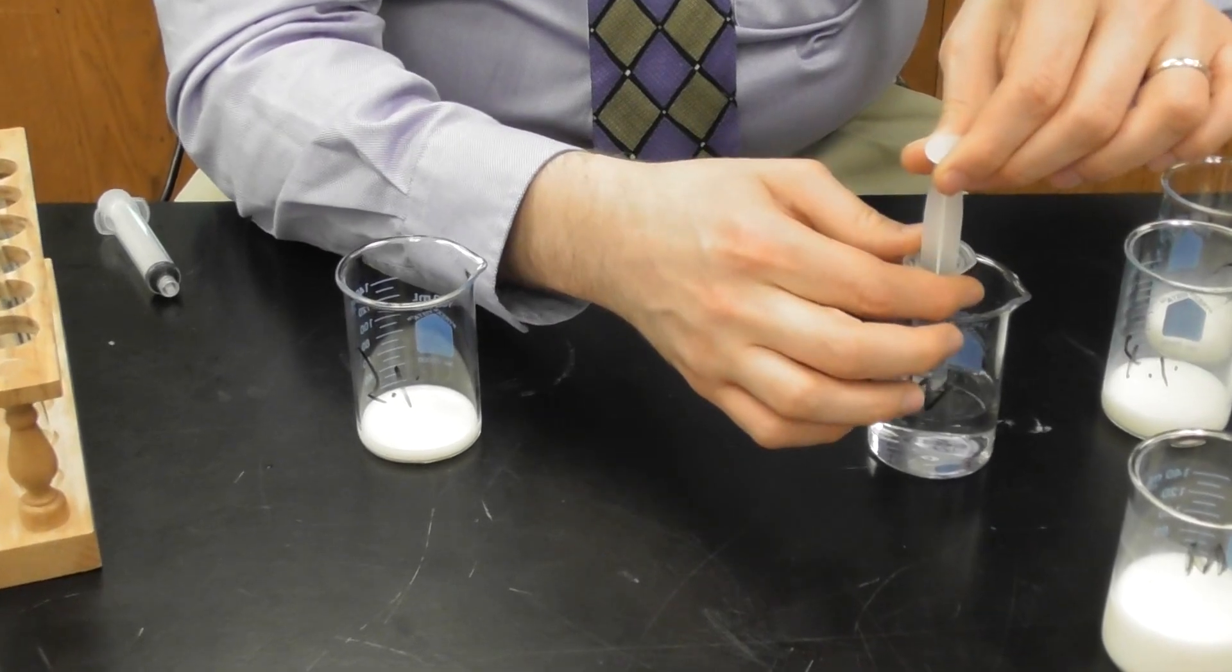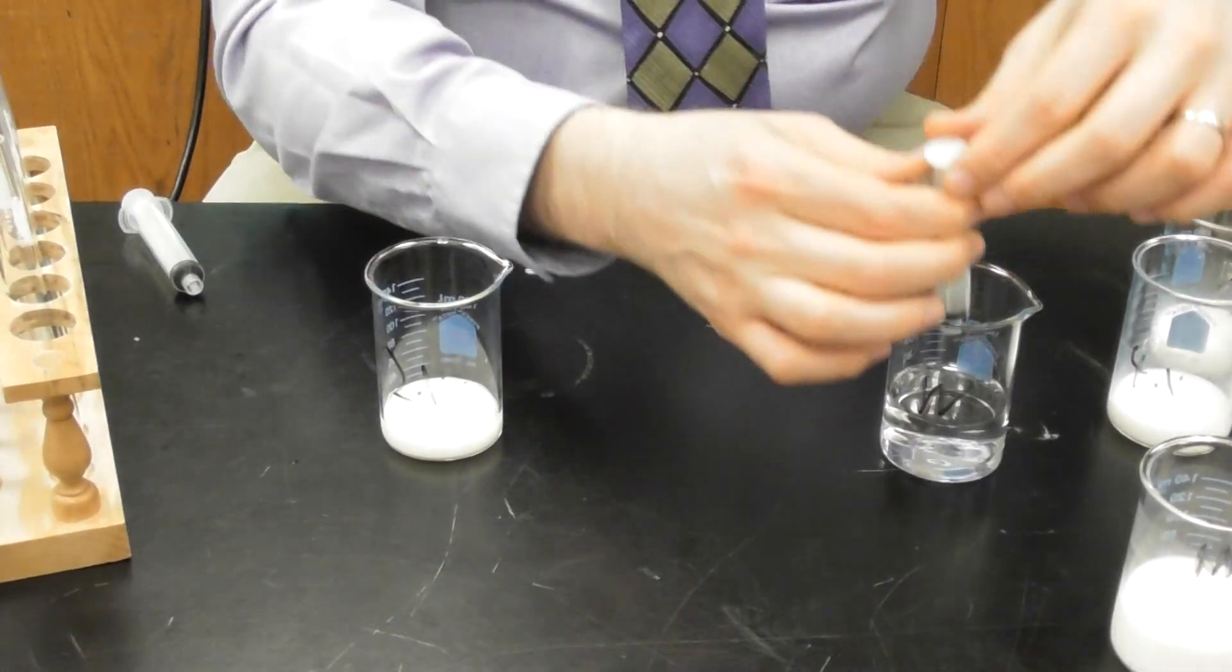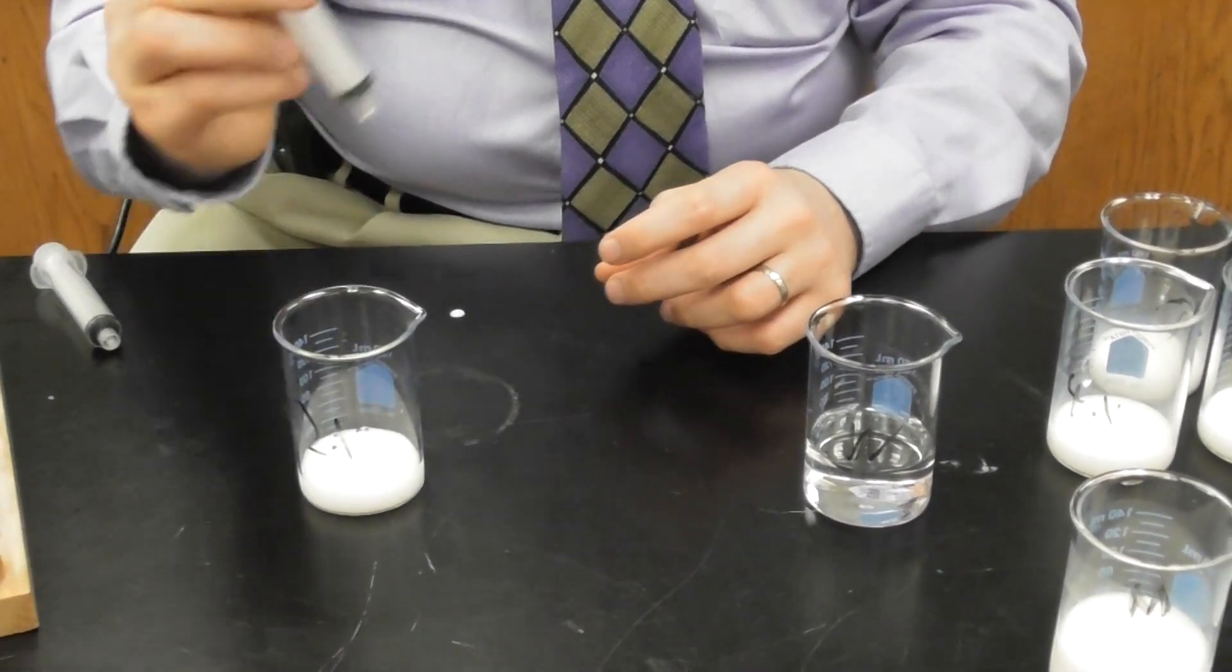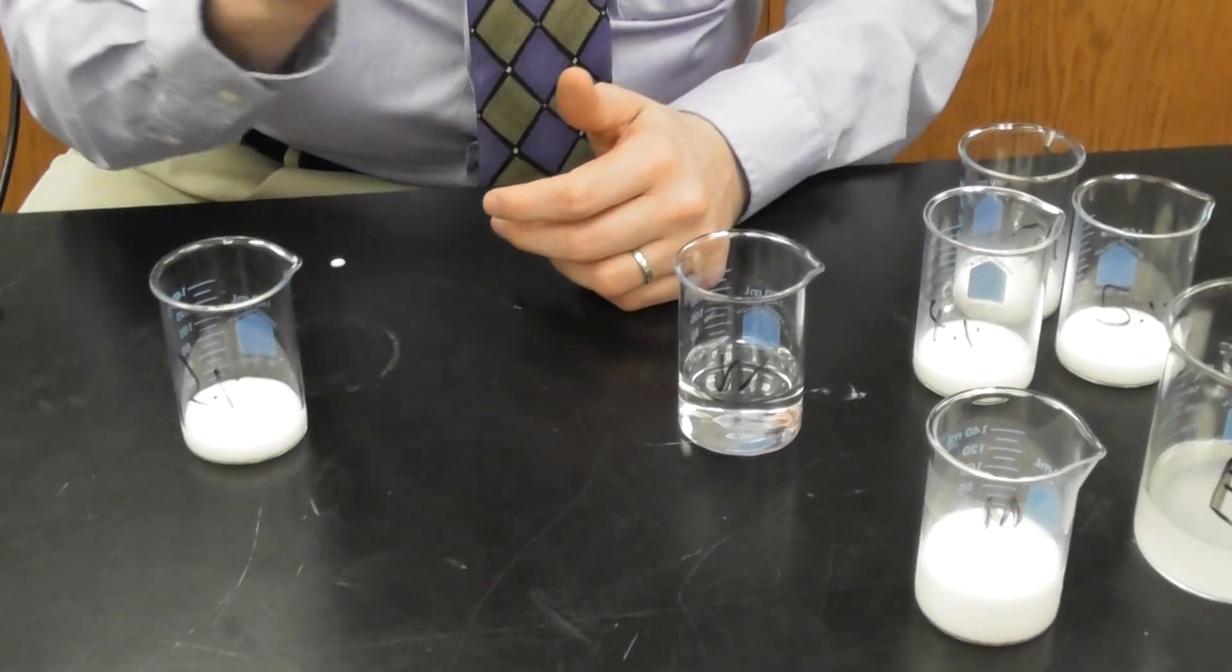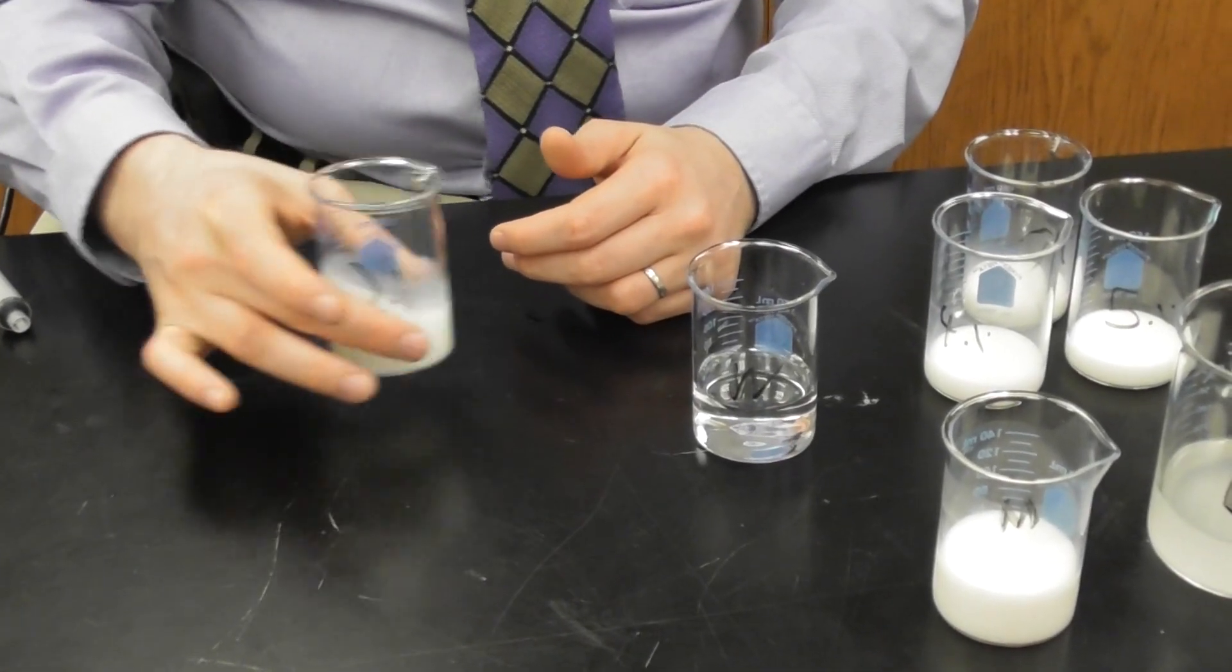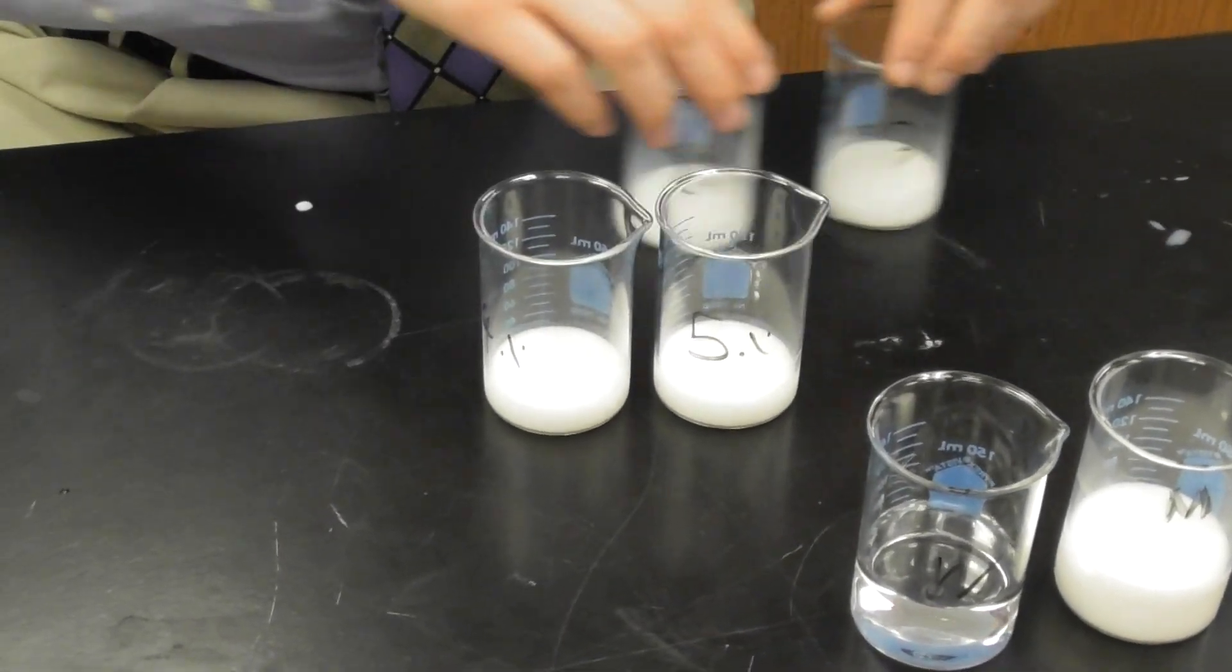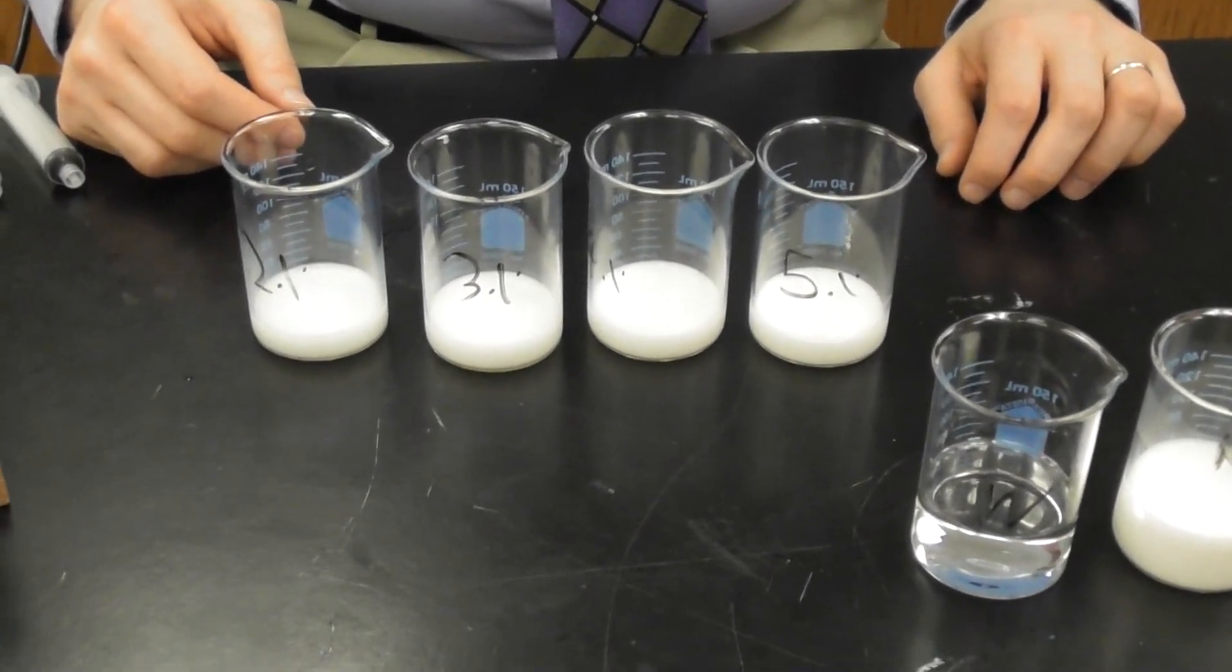Now because this is distilled water, I don't really need to wash this anymore. Just dry that. It's fine. Swirl. Set the water off to the side, and that's simple dilution. Thank you so much.